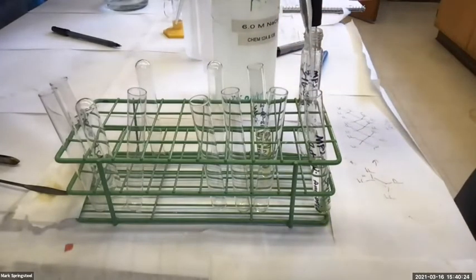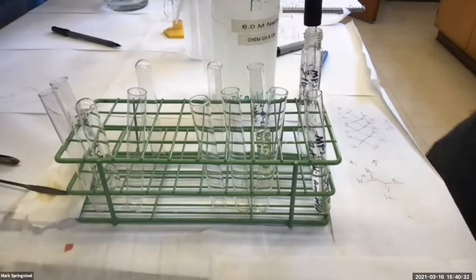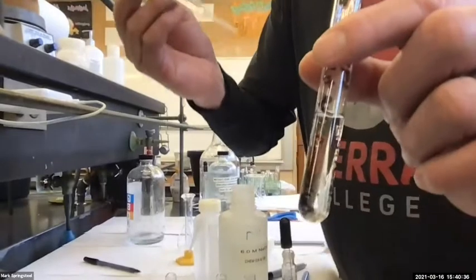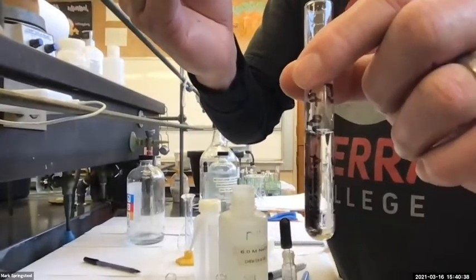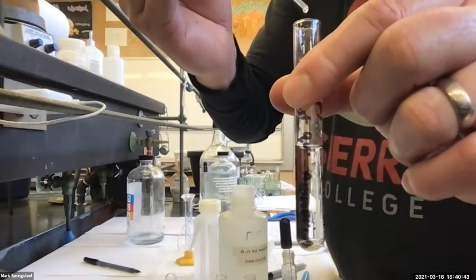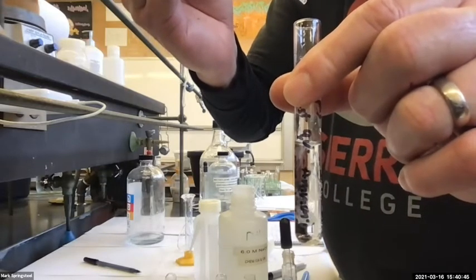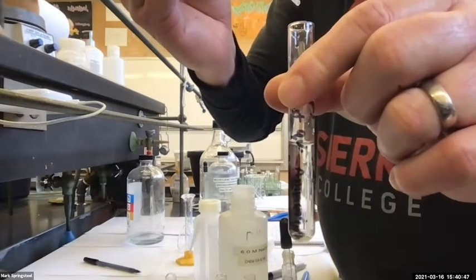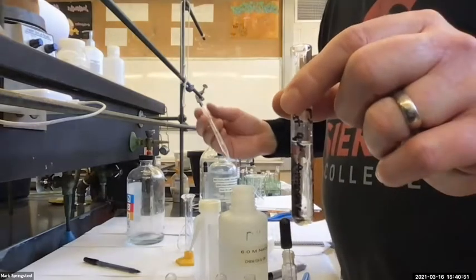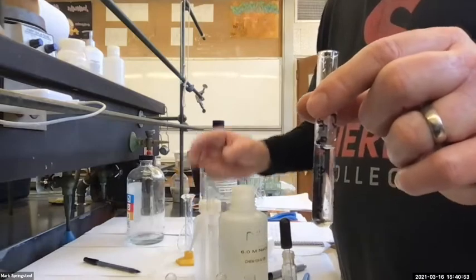Okay, here we go. I'll put my first drop in here and watch. This is pretty cool. Oh, it's working its way down the side. I'll do another one. Do you see that? I'm not sure if you're getting a good enough view of it. I can't believe I'm doing this above my computer keyboard. I'm going to do another drop. See what happened there? What's going on? Anybody have a guess?